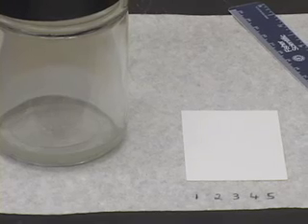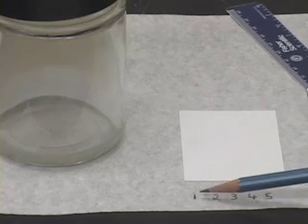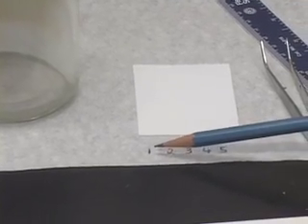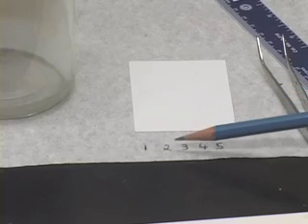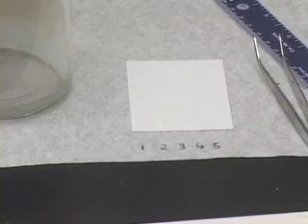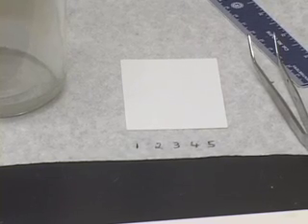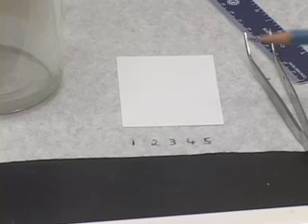What will you be able to see on this particular plate? Spot 1 is due to a particular standard. So, there should be only one spot. What about spot 2? Again, spot 2 is also due to a particular standard. So, you should be able to see only one spot along that line as well.